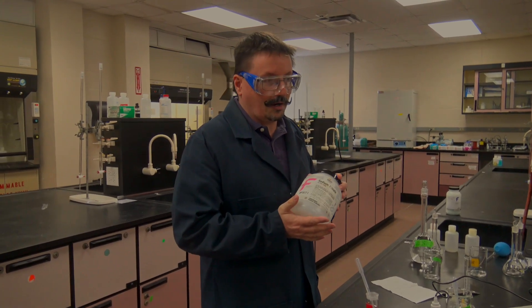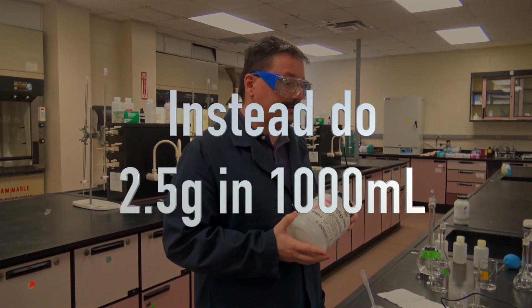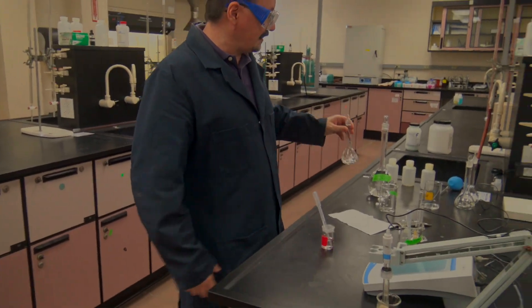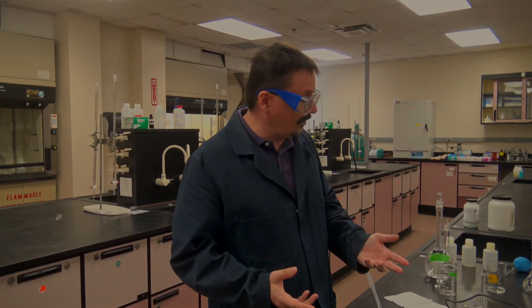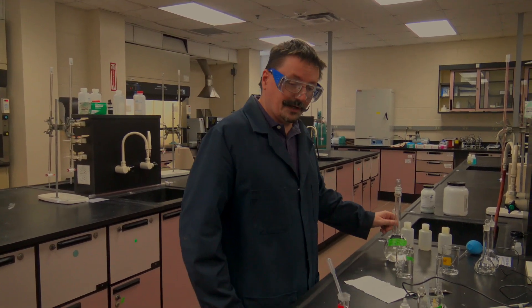We'll have sodium citrate in the balance room. The instructions are for making a liter — 25 grams per liter — but you definitely don't need a liter. Make 100 milliliters by scaling down: 25 grams becomes 2.5 grams. Make it in your 100 milliliter volumetric flask, then transfer it to separate containers when done. That 100 milliliters is enough for three or four people, so you can partition it out. Make sure you free up your volumetric flask later for making your standards.